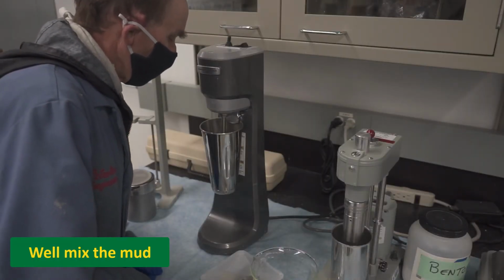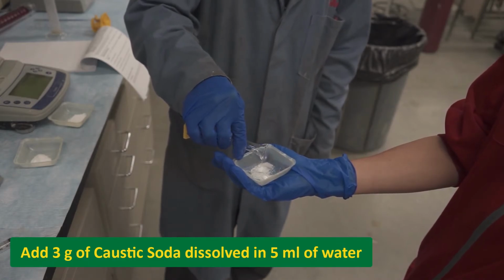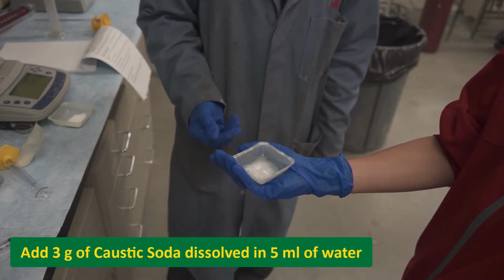While mixing the mud, add 3 pounds per barrel, or in other words, 3 grams of caustic soda dissolved in 5 milliliters of water.